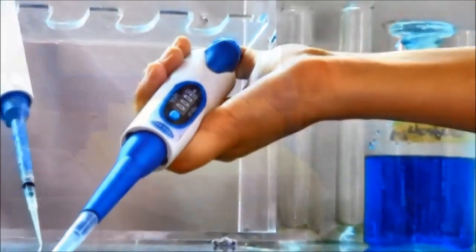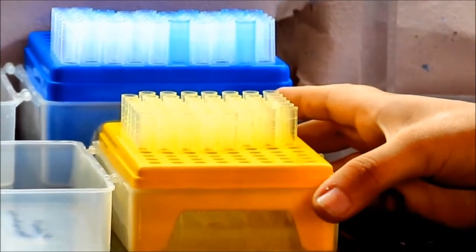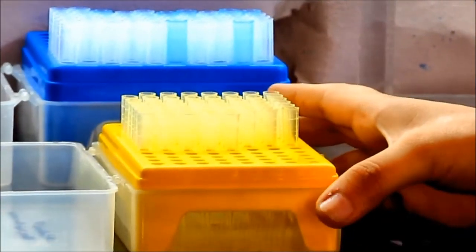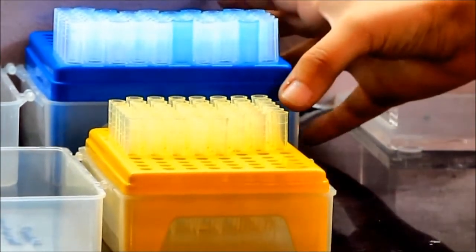These are autoclaved microtips. The smaller tips hold less volume of liquid and the larger tips hold more volume of liquid.